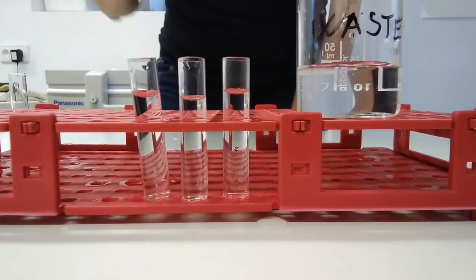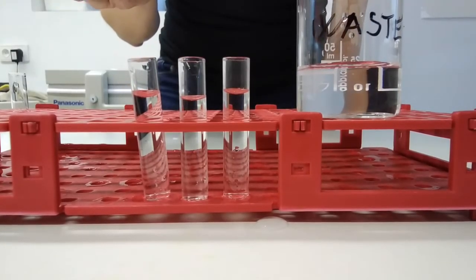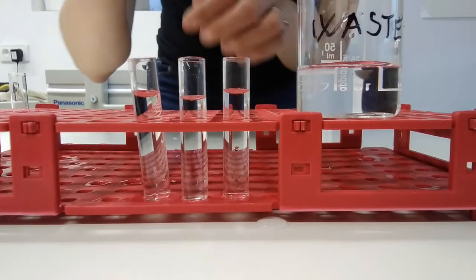When the extraction is finished, we need to put together the three portions of nematodes from the same soil sample collected during the three days.